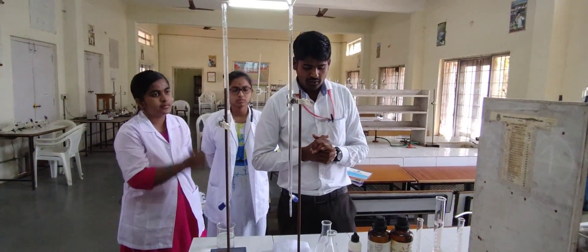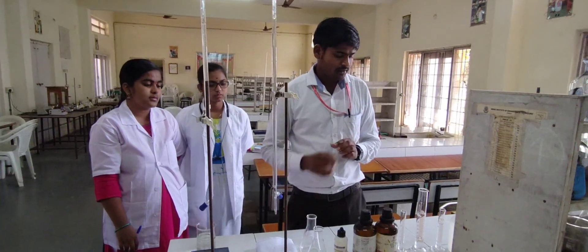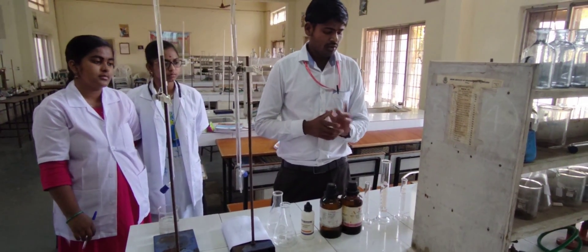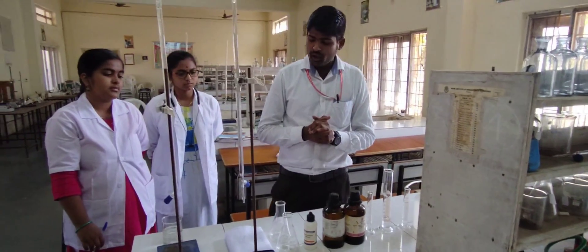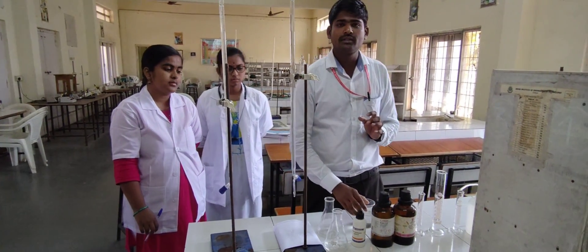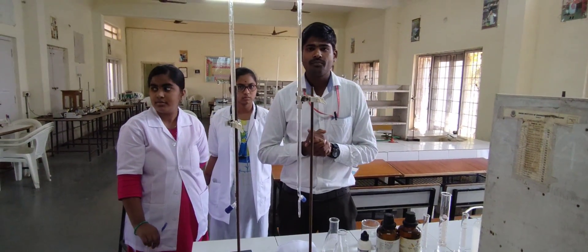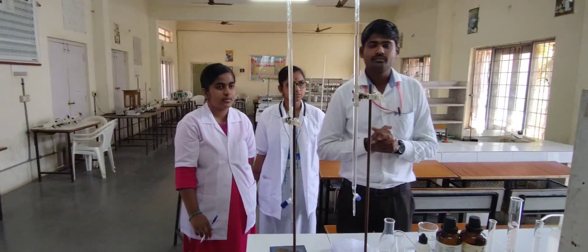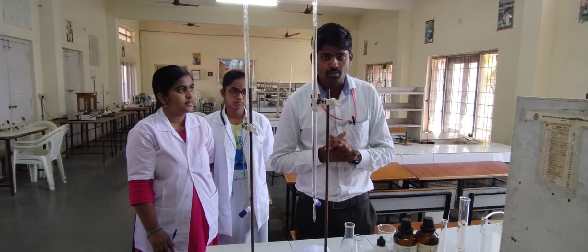Apparatus required: burette stand, burette and funnel, 250 ml conical flask, 25 ml measuring jar, 100 ml measuring jar, 250 ml beakers, and a shaker or magnetic stirrer.